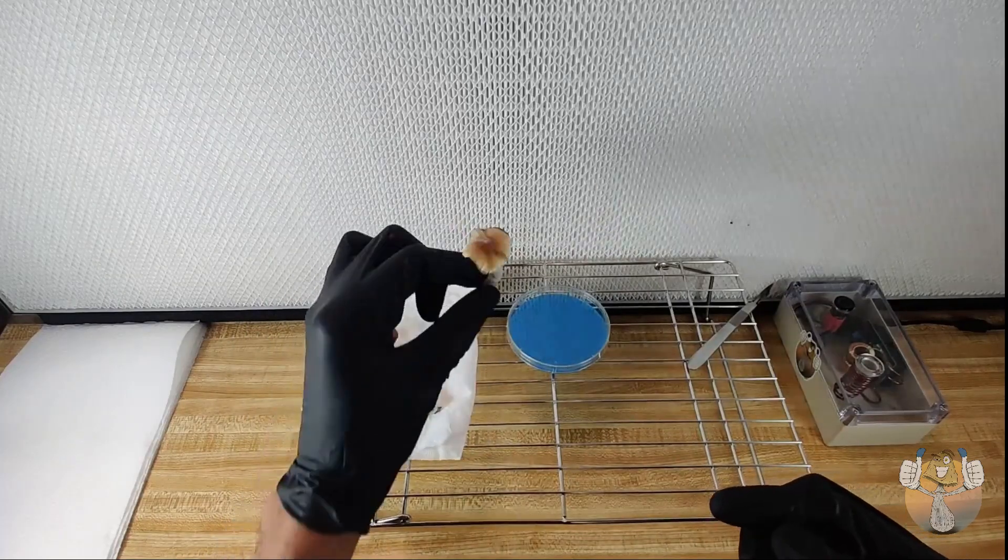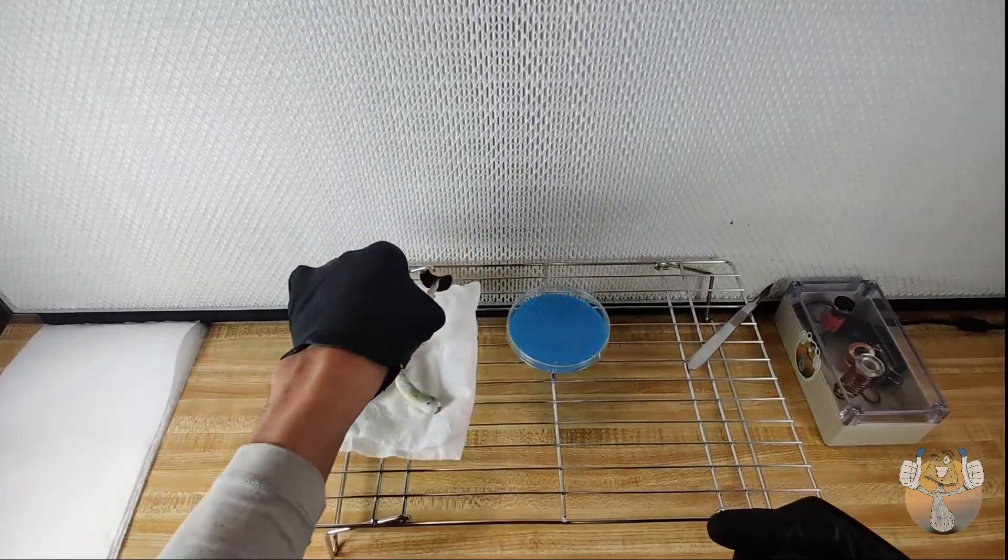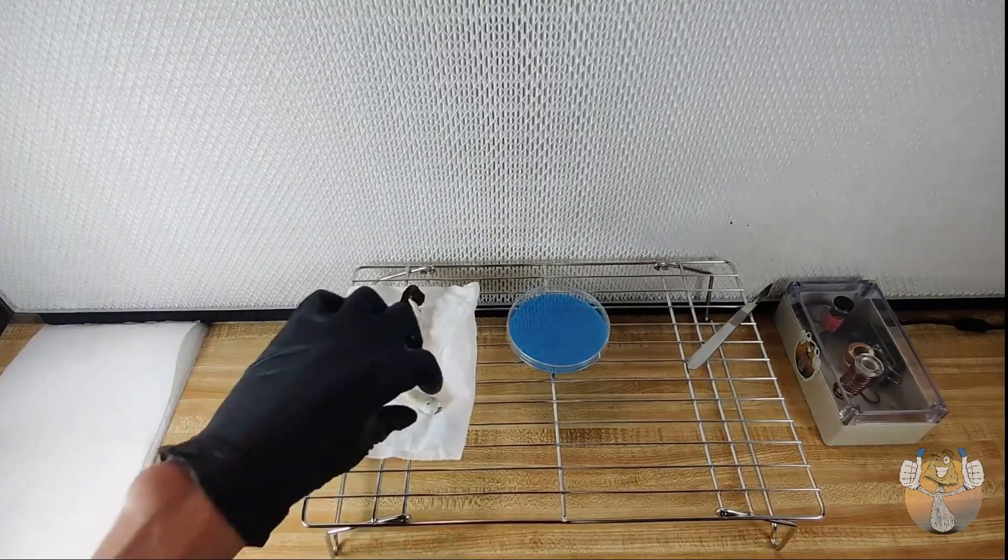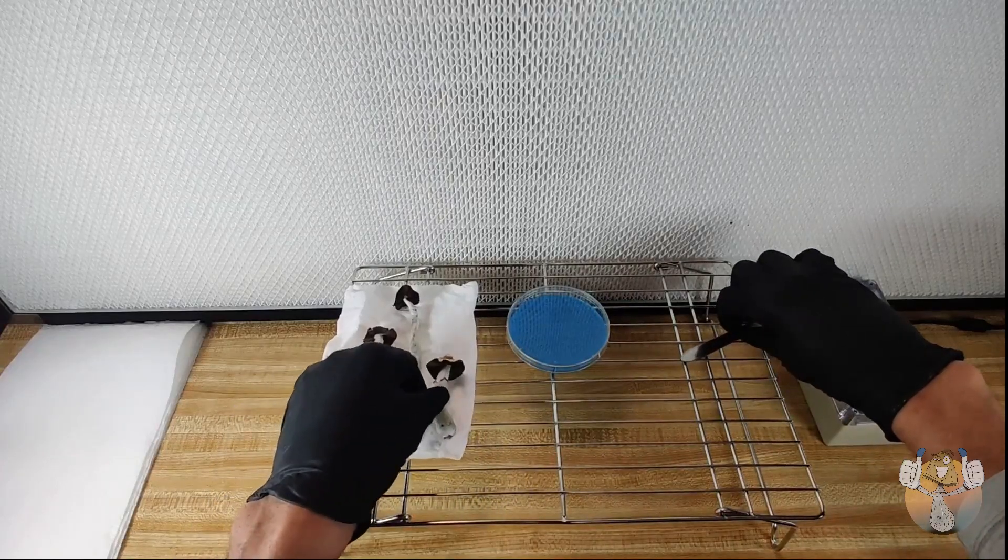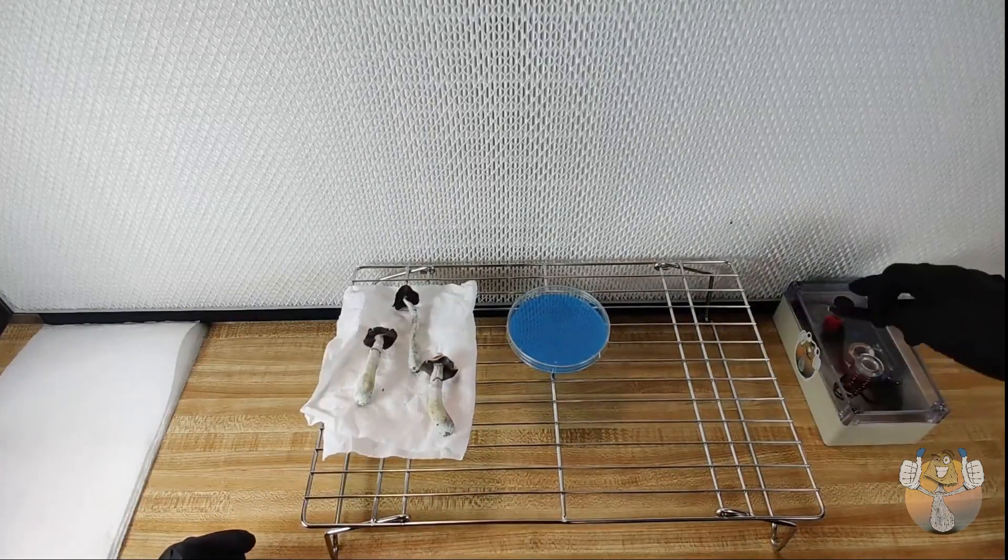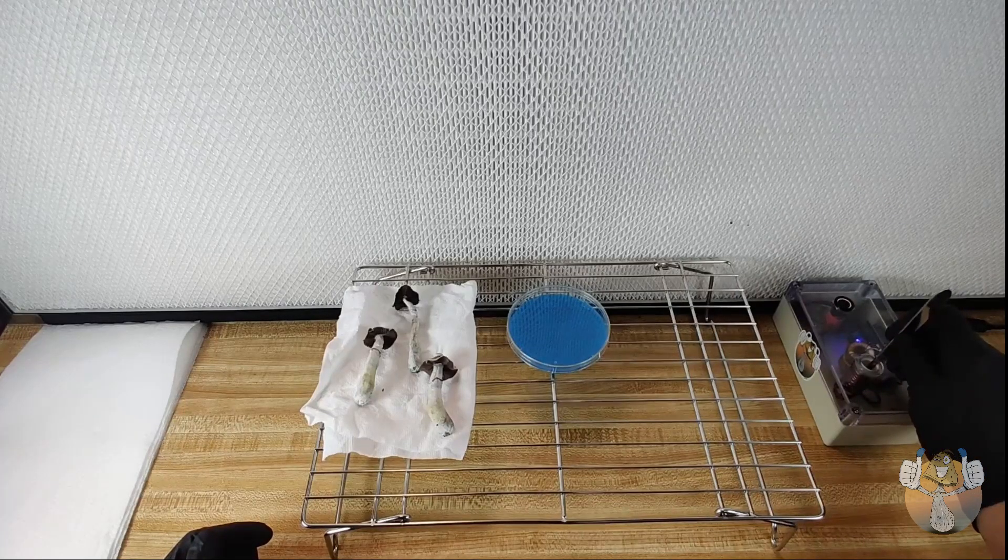All right, so I have been getting asked a lot lately about how to clone mushrooms. Although there are quite a few videos on this, I decided to make one for the people that enjoy my content.